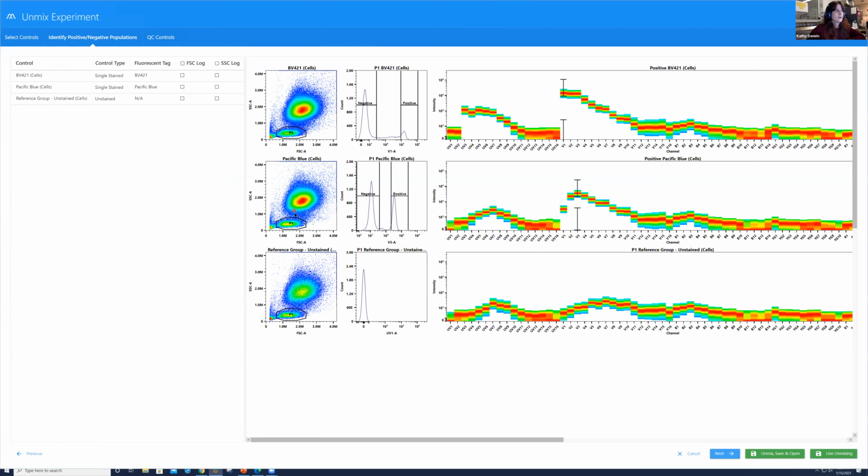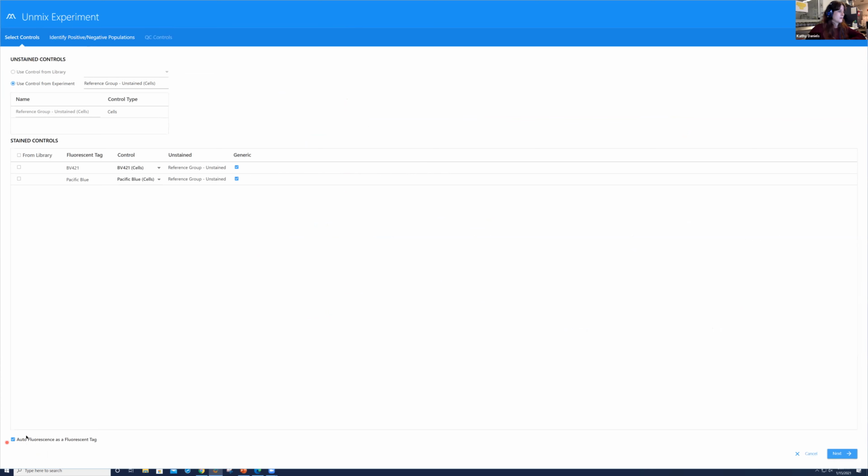You set the scatter gate where you would like it and around the population you would like. If you were analyzing all of these cells, you would make sure that this P1 gate was around the full population, okay? But because we would just be looking at our lymphocytes, we would focus on this. And then we would do live unmixing if we still had samples to record, or if we weren't live recording samples and wanted to look at it after the fact, we would do unmix, save, and open, okay? So that is really all you have to do in the software to look at the autofluorescence extraction.